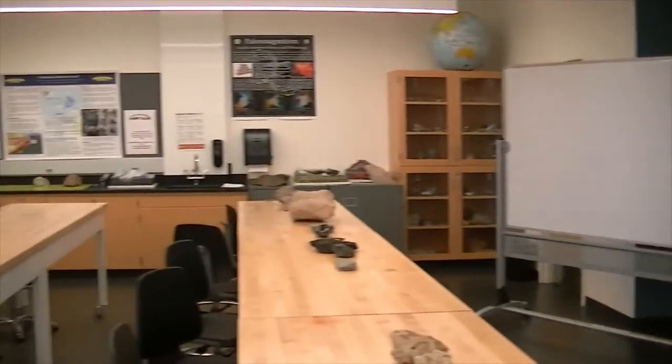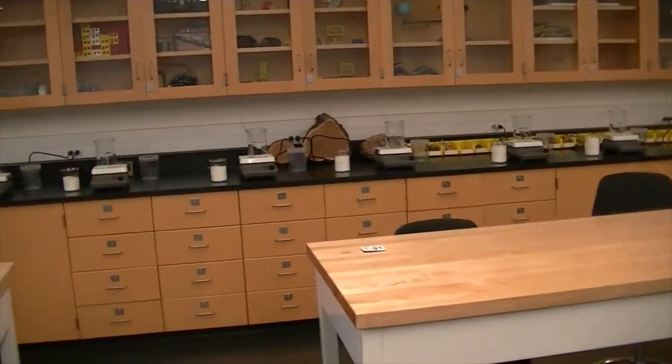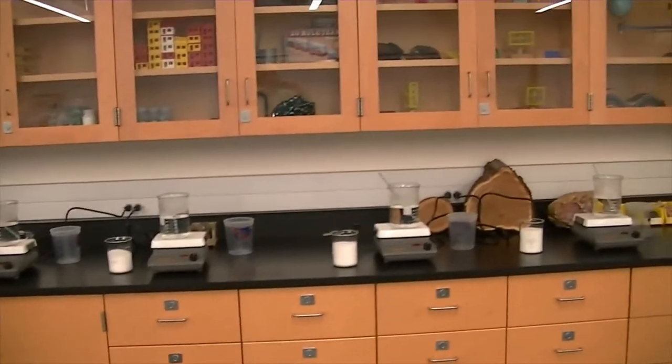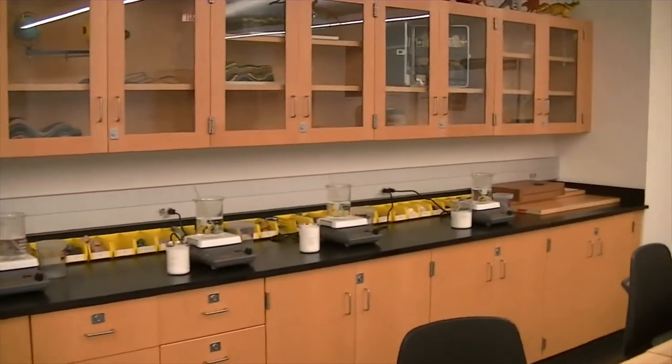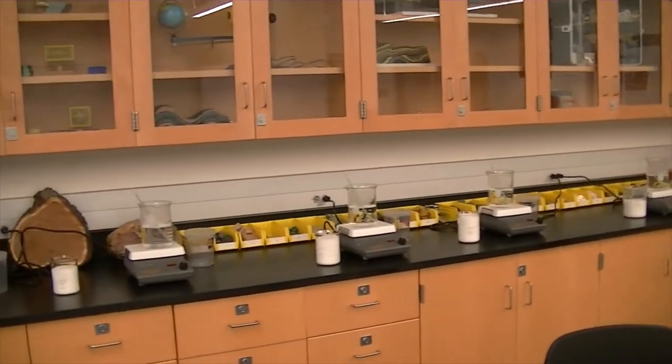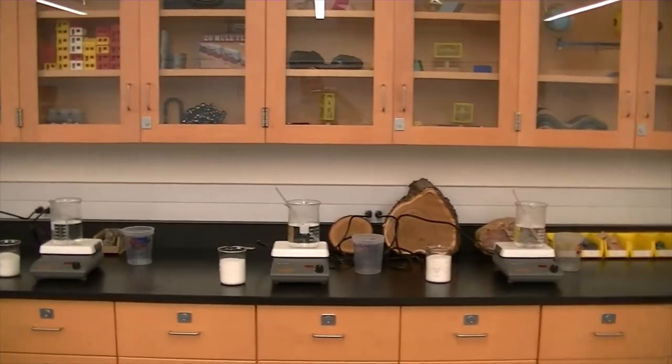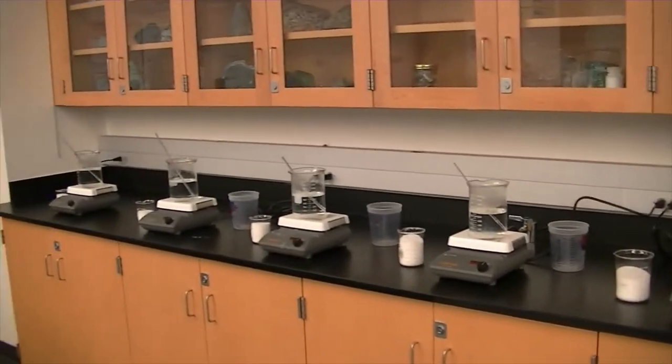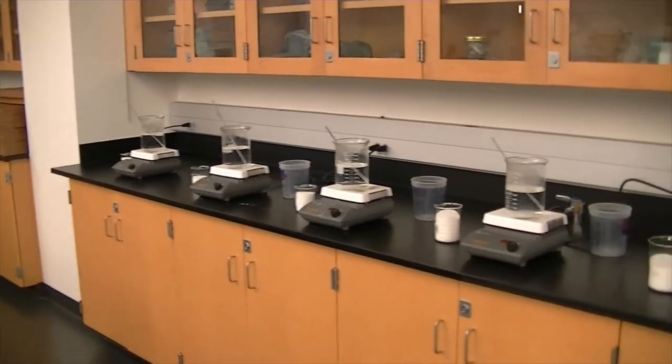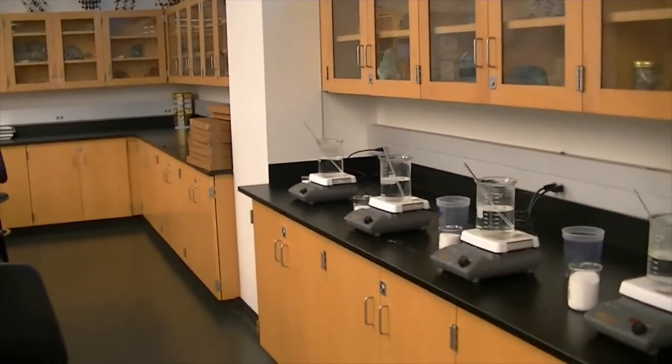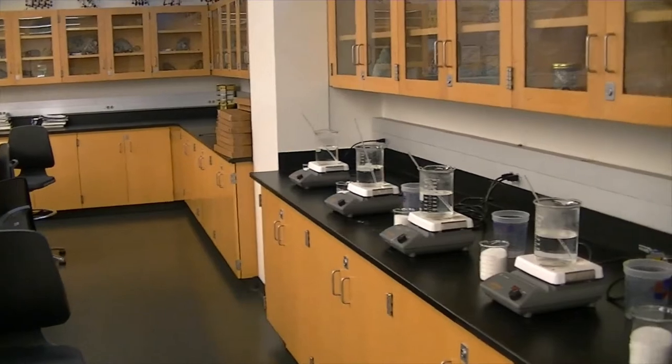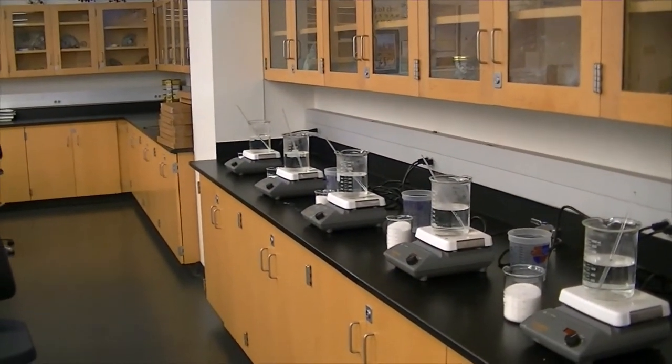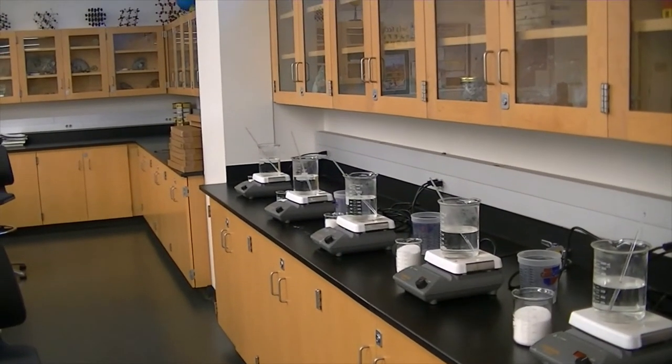So what I'm going to do, I'm going to start the process. I've got a friend coming in to help me stir all these. We're going to stir, we're going to put numbers on them, and then we're going to add food coloring after that cools down. I'm not going to keep the camera rolling for that process because you'd be watching this video for a very long time. I think you have better things to do than watching me stir ammonium phosphate. So we will return when I'm done stirring the concentrations.